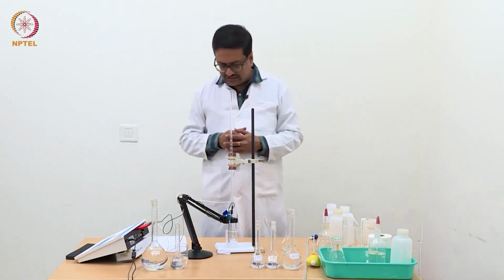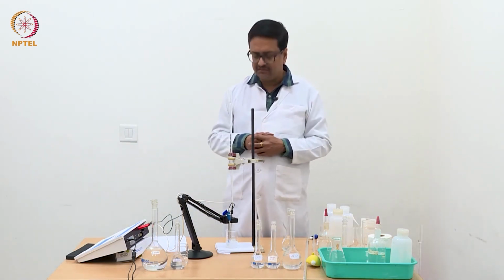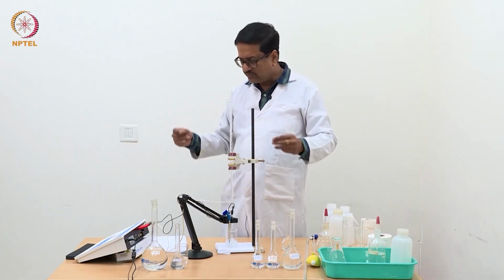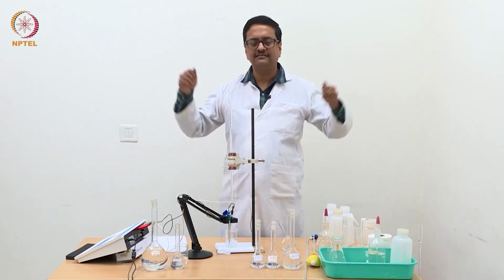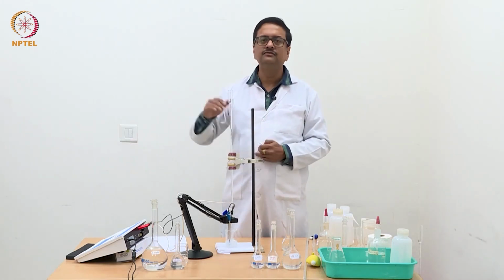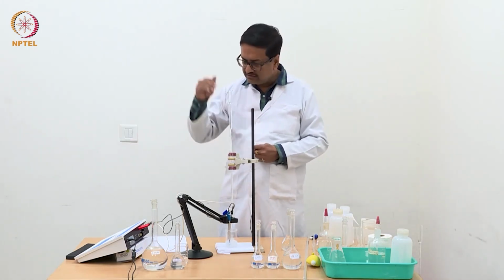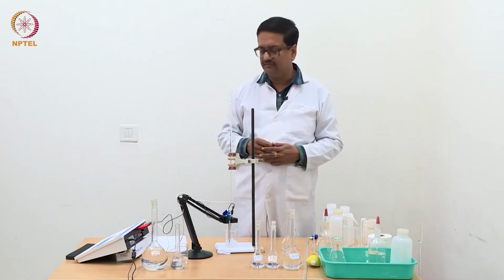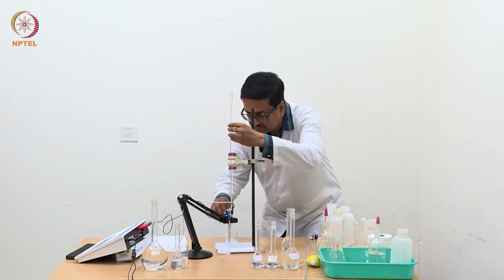So now I am guessing that we are very close to the neutralization or equivalence point, and after another 1 or 2 readings we will start seeing that the conductance value increases, and then we will take a call at what point one should stop the addition.